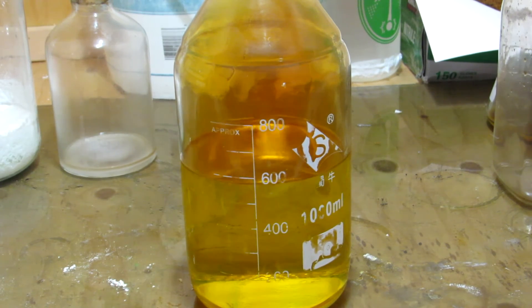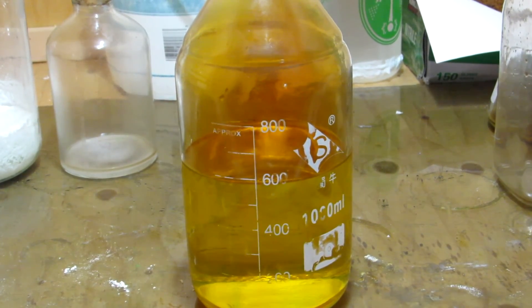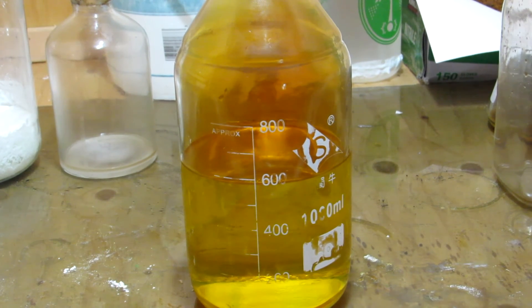So, this nitric acid is useful for various nitration reactions, and in general, it is just a useful acid to have around the lab. So, I hope you guys enjoyed this video, and I'll see you in a future project. Okay, bye.